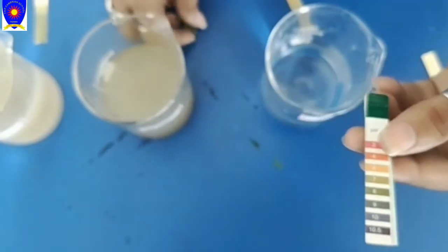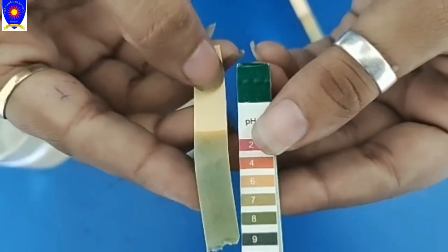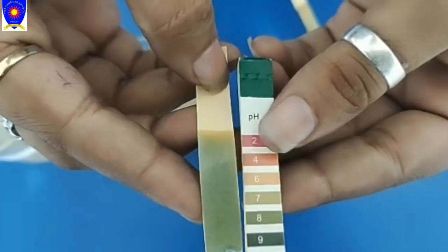Second, the water was pond water and the pH strip, you can see the color is slightly 7 or you can see it's up to 8 exactly.